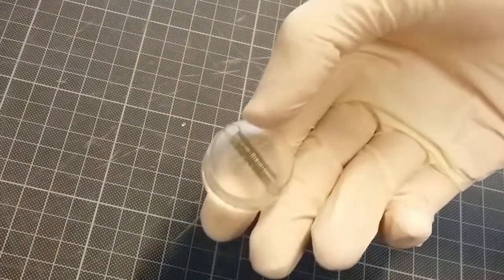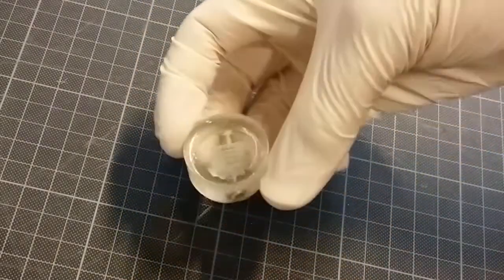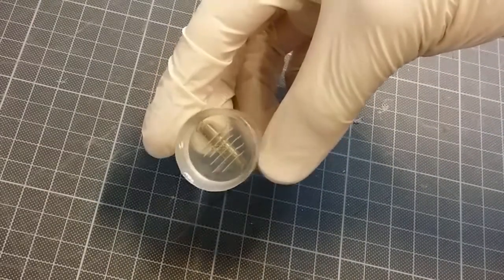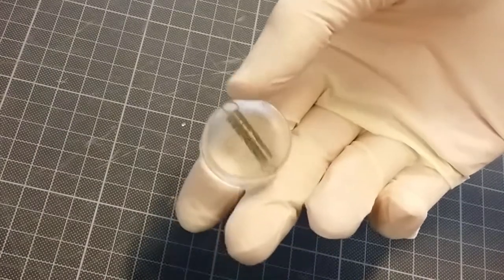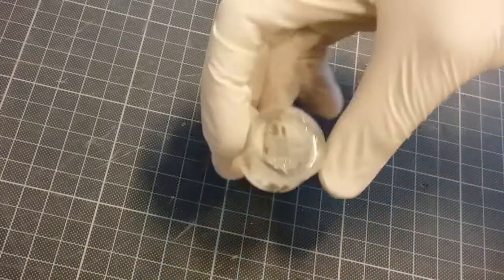So here you can see the sample after it's been embedded in plastic. You can see a small metallic spring with several pieces of paper. The spring is used to make the paper stand upright during embedding.